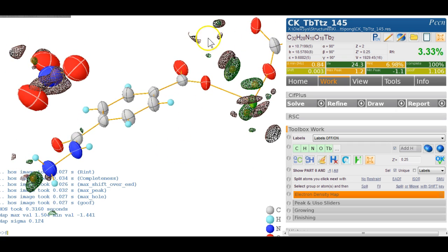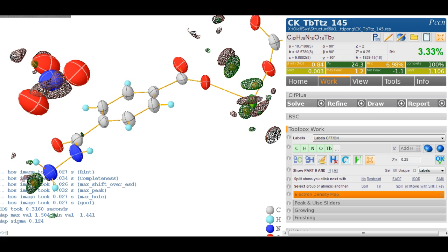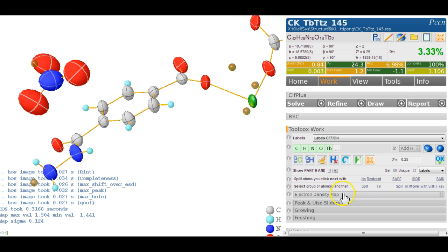And well, there are obviously some fairly big peaks around the terbium, but that's maybe just the way it is. But nothing looks too dreadful around the nitrate. So yeah, I think this is probably the answer to this problem.